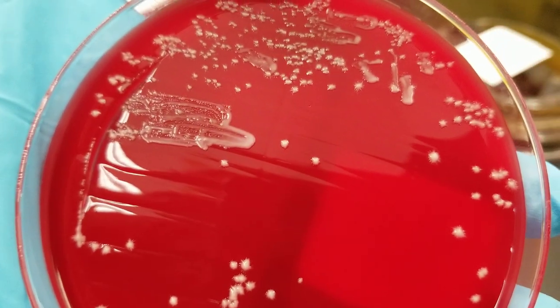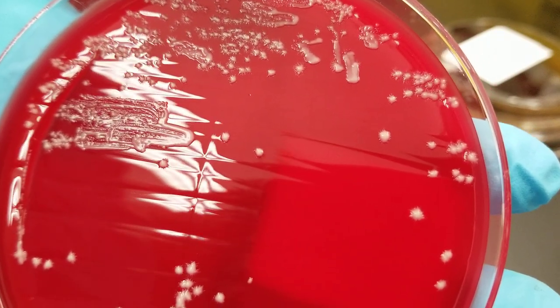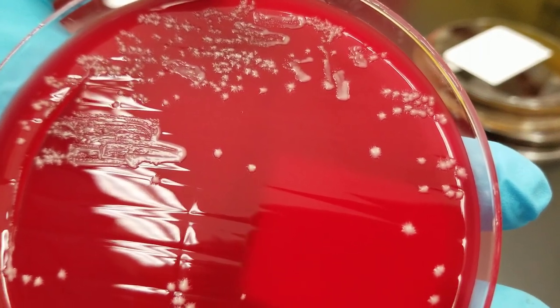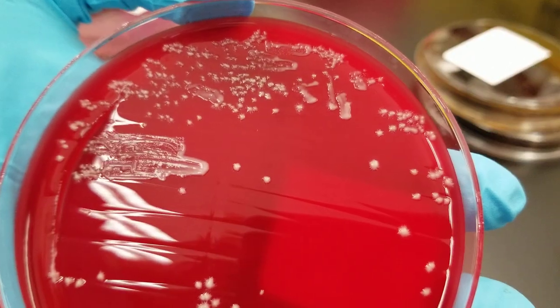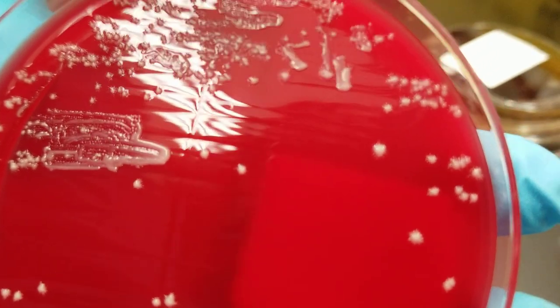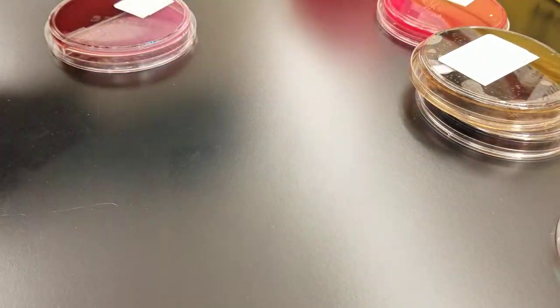You can also tell if it's yeast by the growth rate. This looks like a yeast infection. We were saying there might be a transient yeast colonization, but if this person came into the hospital because they were having trouble, this is not considered transient. Look how many there are — this would be considered clinically significant. The colonies have really nice feet on them, so they don't have that perfectly smooth border.